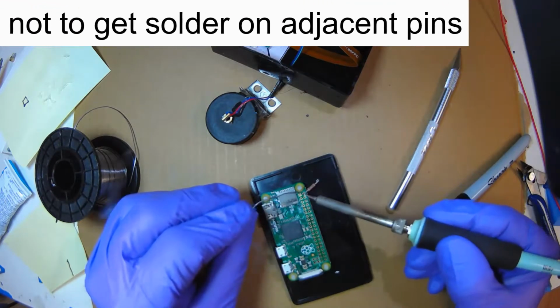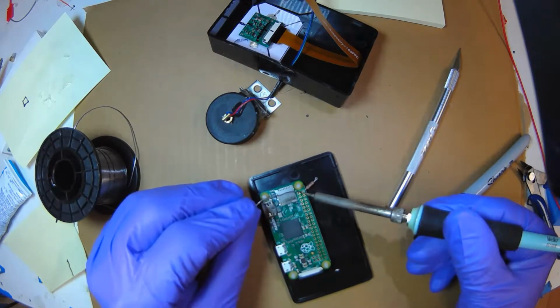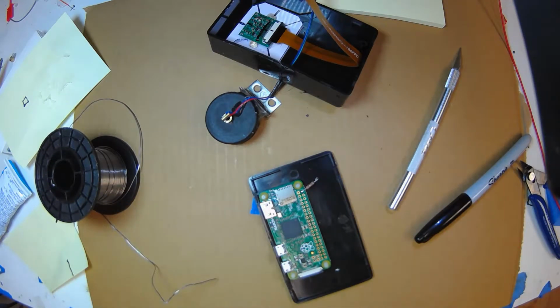Oops, let's see, now I have a bigger bead. I'm going to put that bead right on it. So it's thermally conductive. Now solder, I'm touching the joint, not the iron. You can see how hot it is. It's just flowing. That's beautiful. And then lift, let it cool by itself.